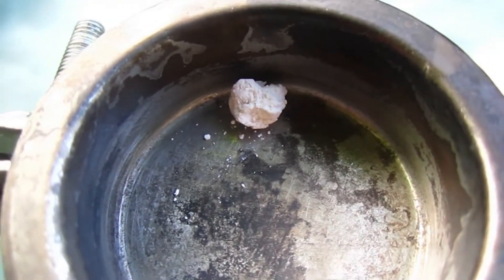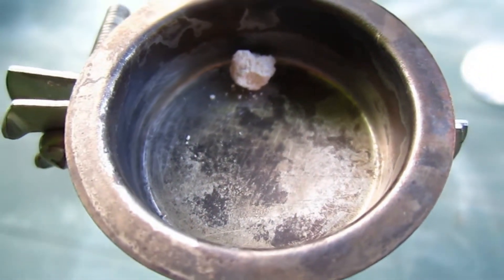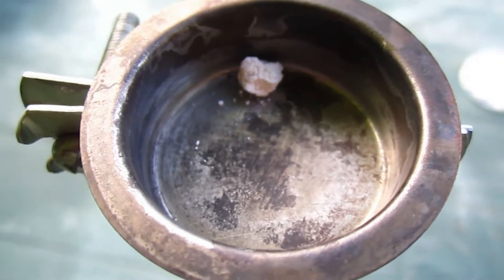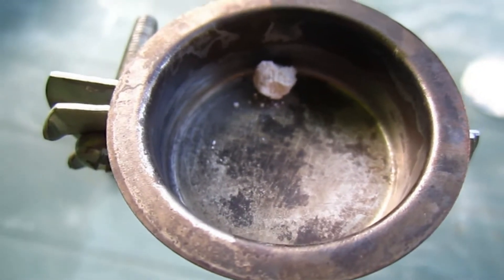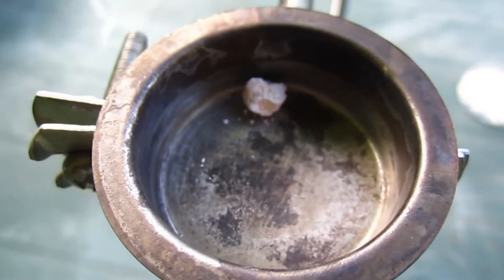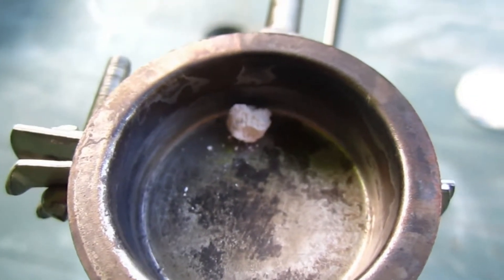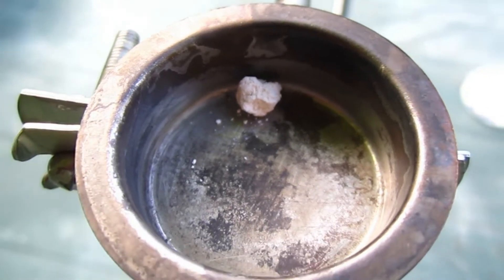So now I'm actually going to analyze whether my benzoic acid was actually chlorinated, because they all look pretty much the same — they are all white powders, and I could just have benzoic acid here.